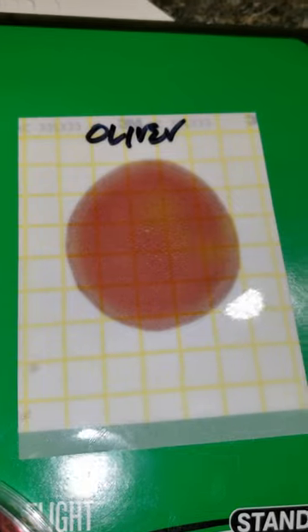This is what's called a petri film plate made by 3M. This is an aerobic plate. When we culture this out, this red circle is basically the broth that we use. It's a red-violet color. As we incubate it, you can kind of see the yellow discoloration just a little bit, probably around the 1 o'clock and 3 o'clock position — very small amount. That is your lactic acid bacteria fermenting and transforming that red color to yellow. Predominantly normal is red, and as we culture out more and more lactic acid bacteria, this is going to change.